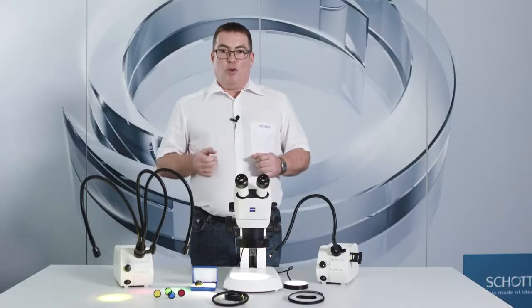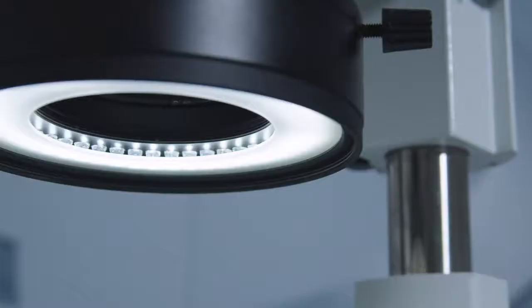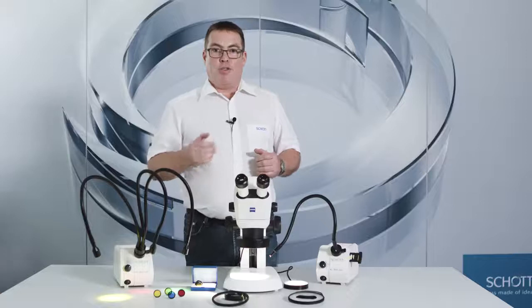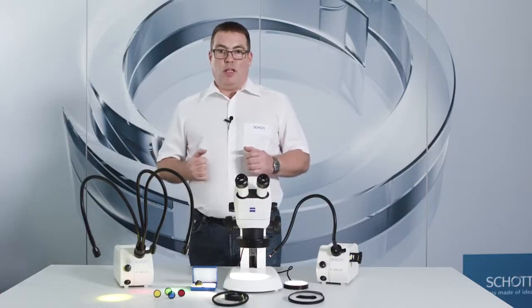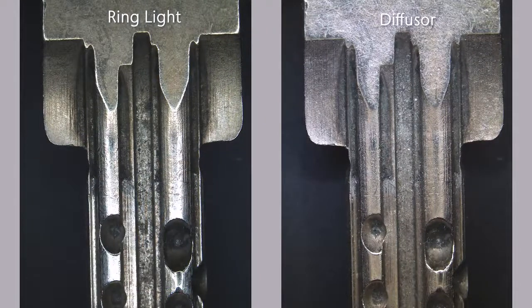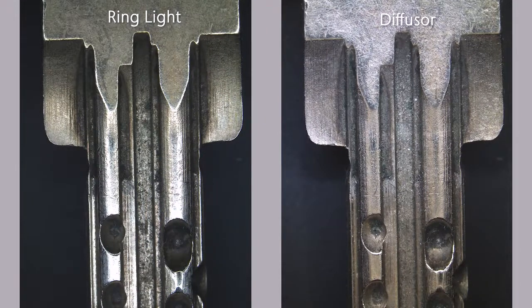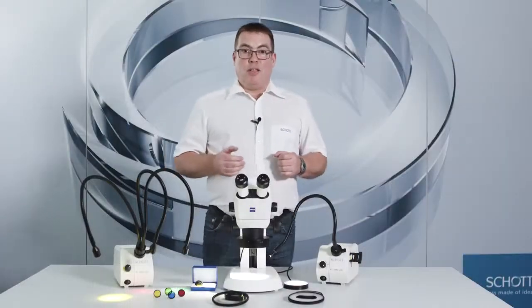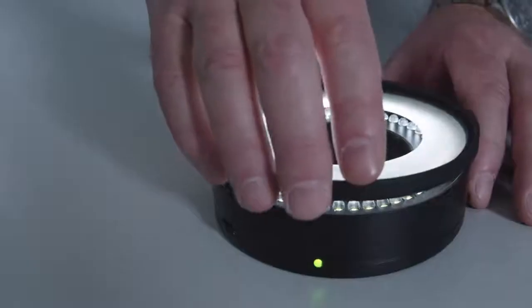Let's move on to diffusers. Diffusers can be used to create a softer diffuse light, which can help to reduce reflections on the sample surface. Using the key as an example, it is easy to see the effect that the use of a diffuser can have. Diffusers are available for our easy LED as well as for various Visi LED ring lights.